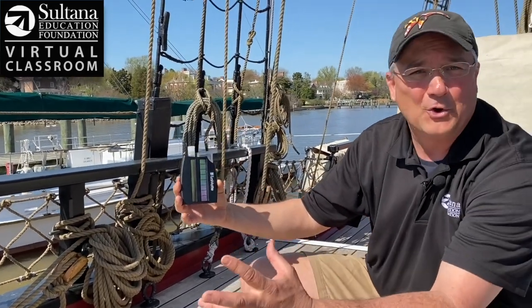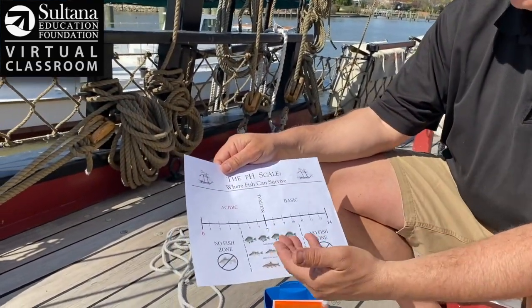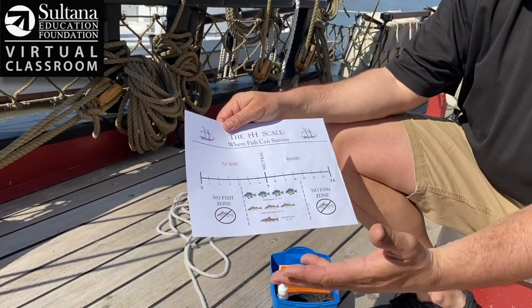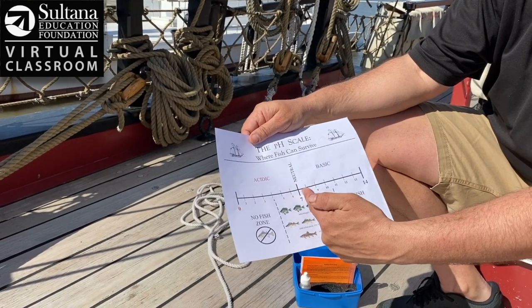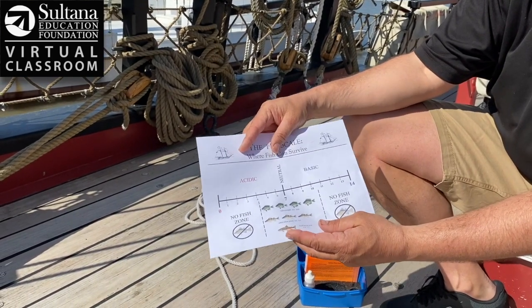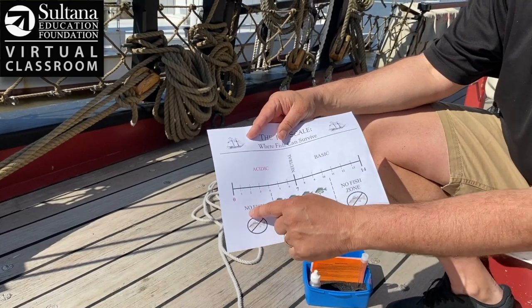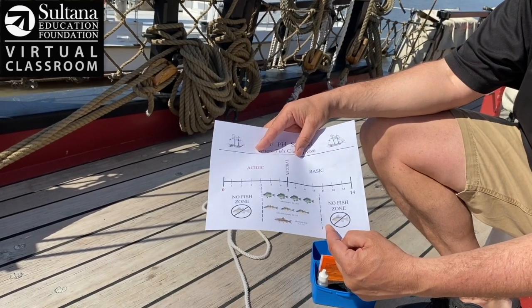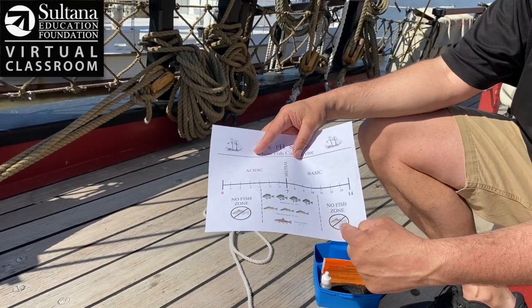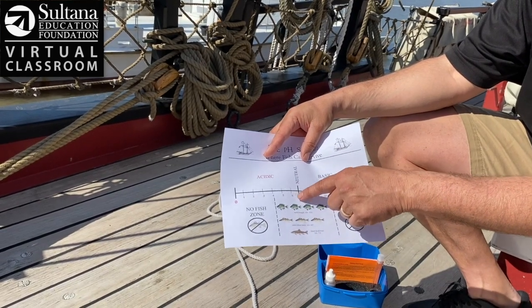The last step is to figure out why we care about that result. Fish can only live in certain pH ranges. We determined the pH was somewhere between 6.5 and 7.5. If the water were too acidic — below 4 — we'd be in a no-fish zone. Or if the pH had been above about 10.5, we'd also be in the no-fish zone because the water would be too basic. Today, our pH was right here in the middle.